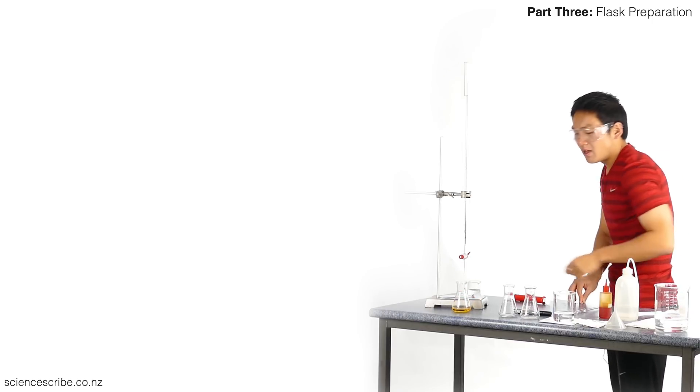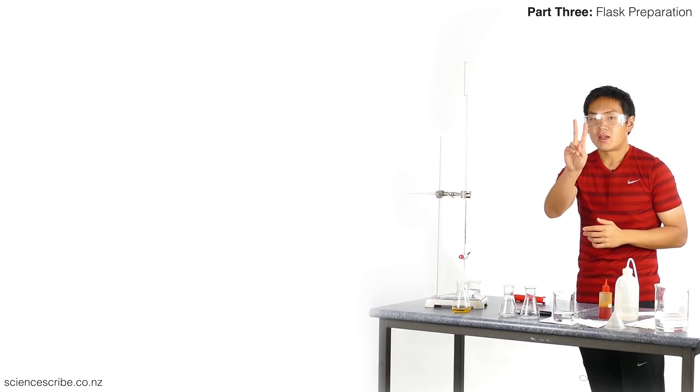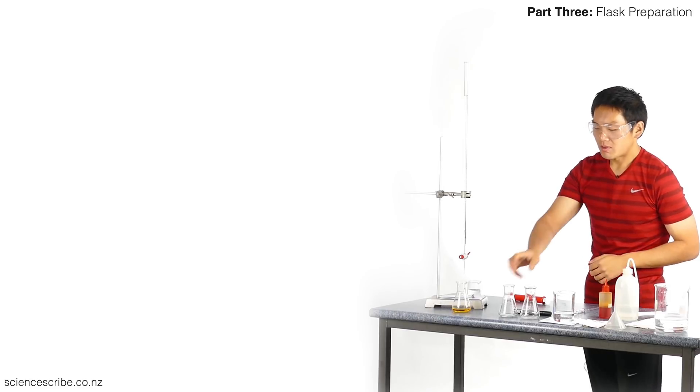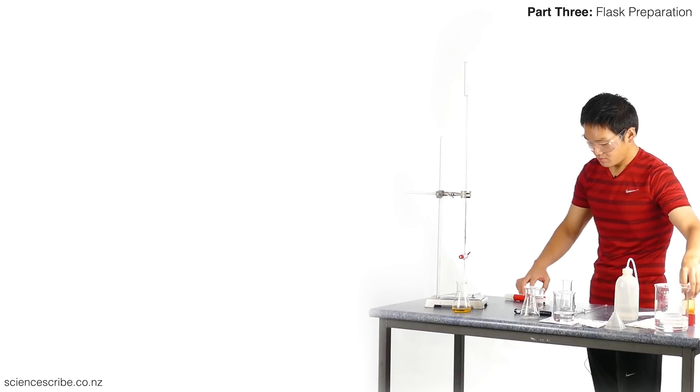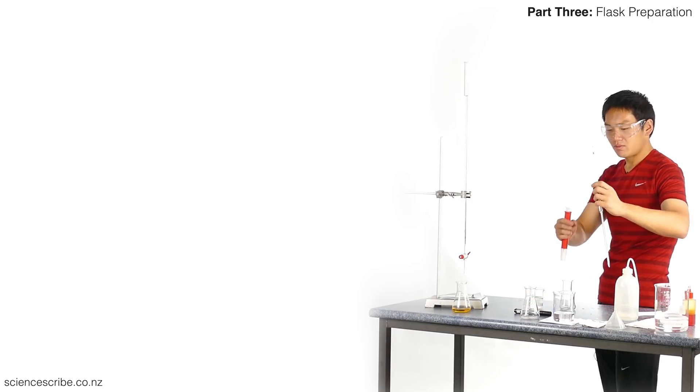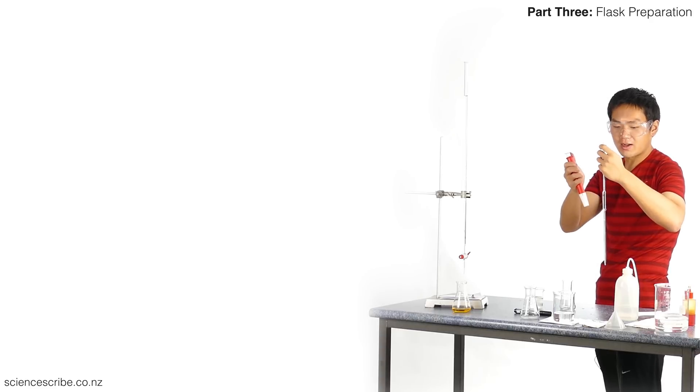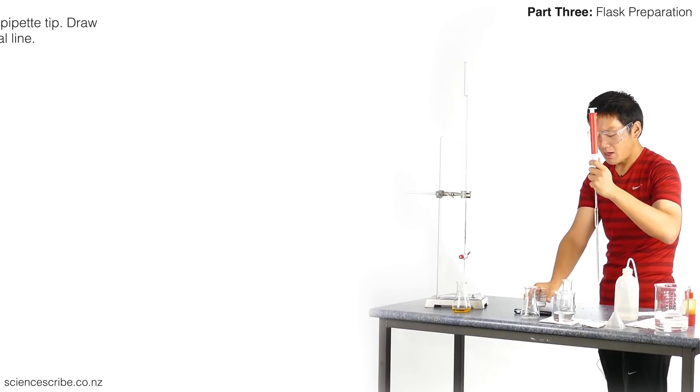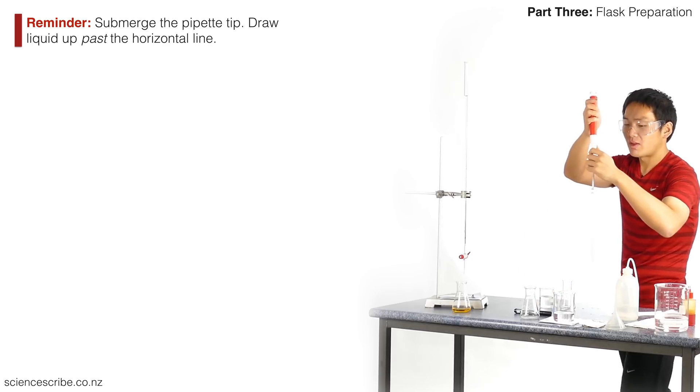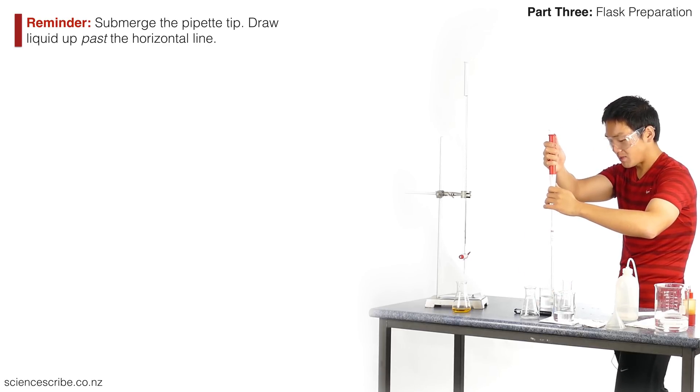I did say earlier that I wanted to prepare two flasks to start off with, so I'm going to go ahead and do the exact same thing for my second flask. You'll notice that I just moved stuff out of the way because I don't want to create a random spill. I want space, I want to make sure that nothing is ever contaminated.